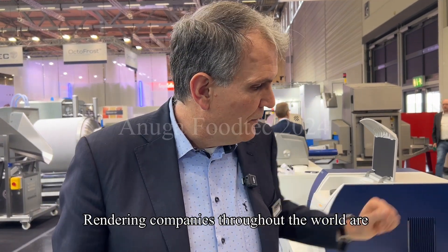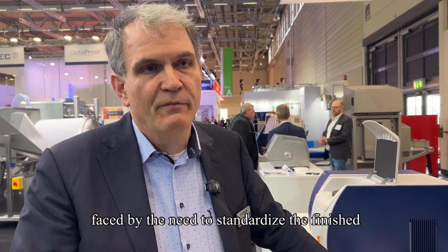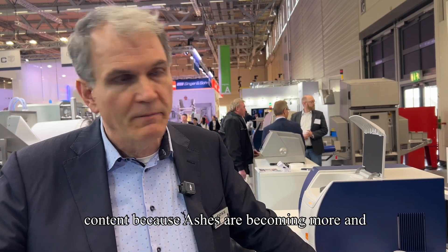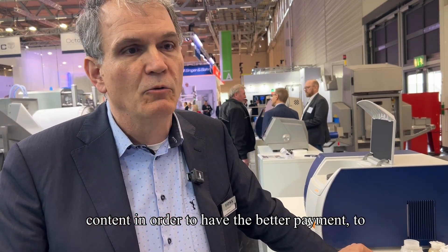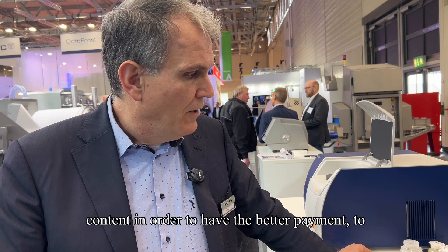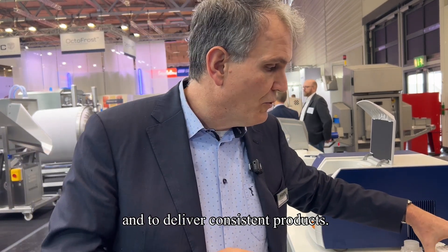Rendering companies throughout the world are faced with the need to standardize their finished product, mainly at the protein content. Recently, protein content has been aligned with ash content, because ashes are becoming more and more important for feed producers and pet food producers. Protein must also be delivered at the right content in order to achieve better payment and to be selected by the best suppliers.